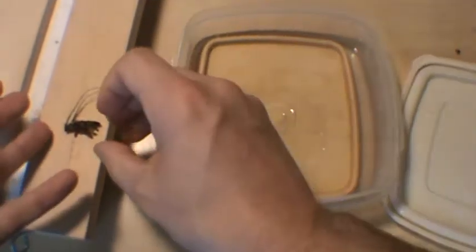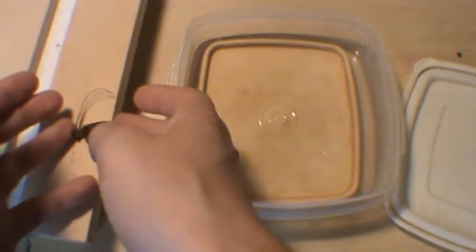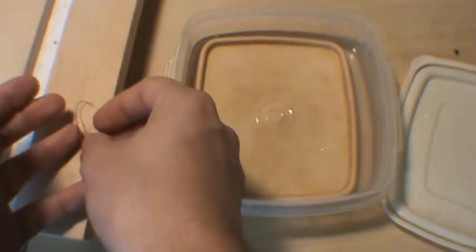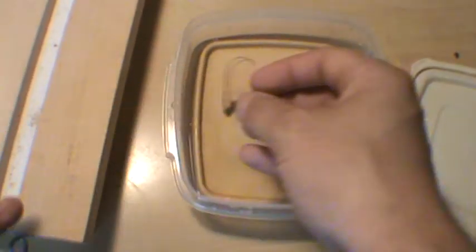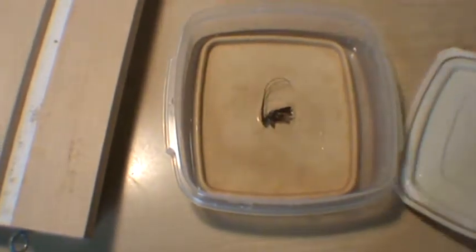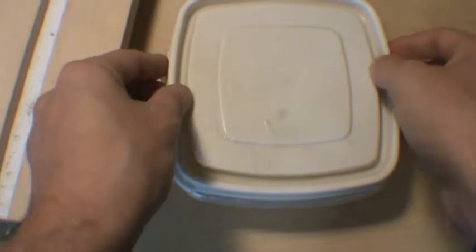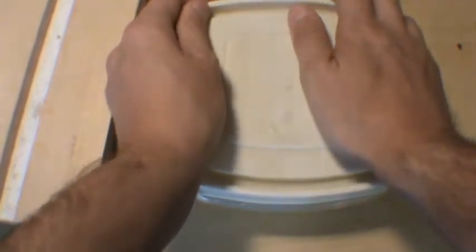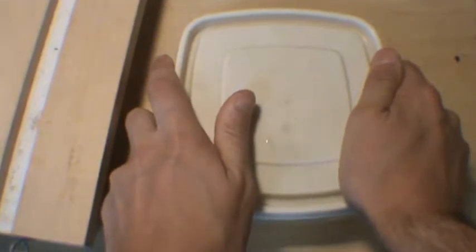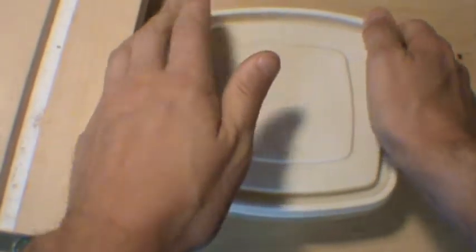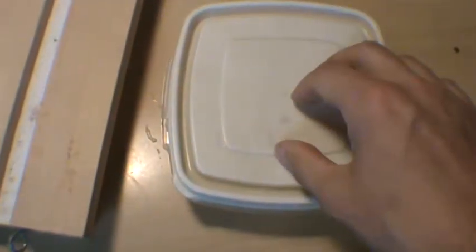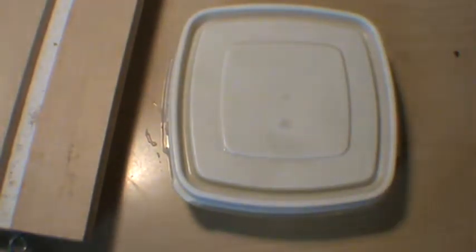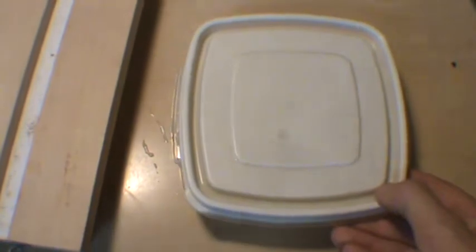Because we are exposing the beetle to a moist environment, bacteria, that's a good place for bacteria to grow. So we put the alcohol in there specifically to impede that bacterial growth. What we're going to do is we're going to pick up the little beetle. Come here dude. Not by the antlers because they're fragile. We're going to stick them in there, and then we're going to snap the lid on. This creates an enclosed environment around the bug. And the bug is drier than this environment, so moisture will go into the bug. After a couple days in here, that bug will be as pliable as if it were brand new. And then you could easily manipulate and pin it. And of course, always make sure your trash is thrown away and your label goes with your bug. Label with bug.